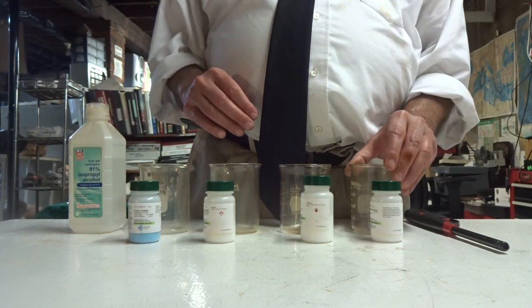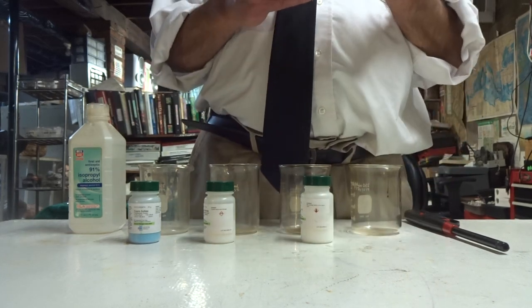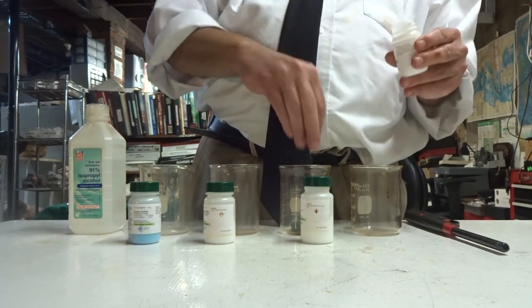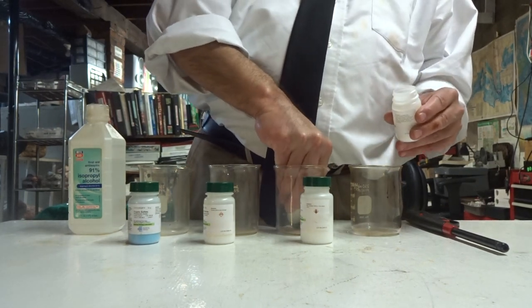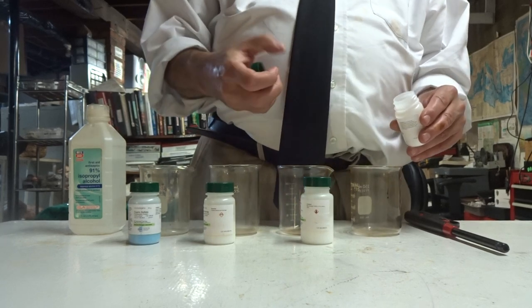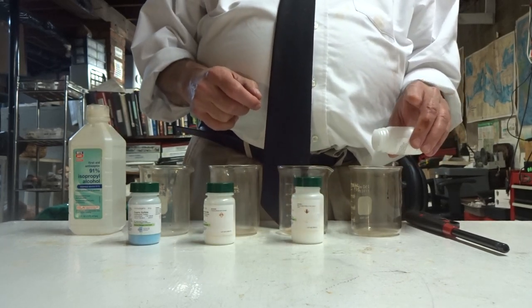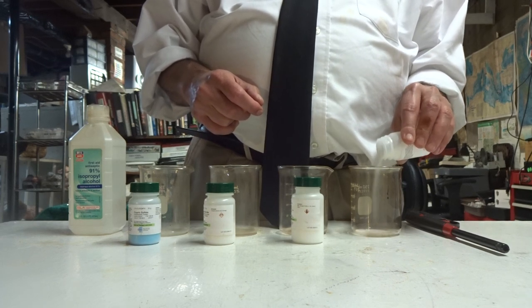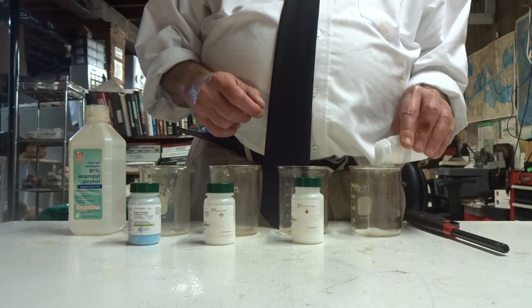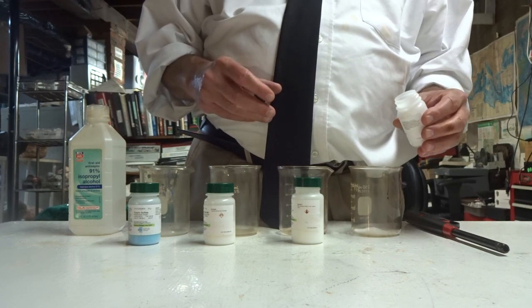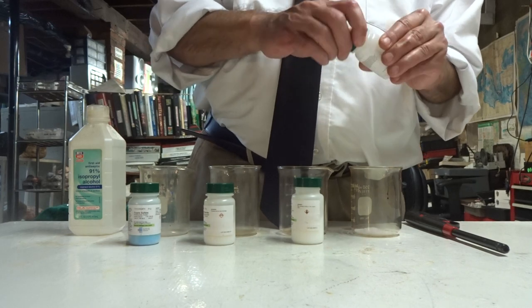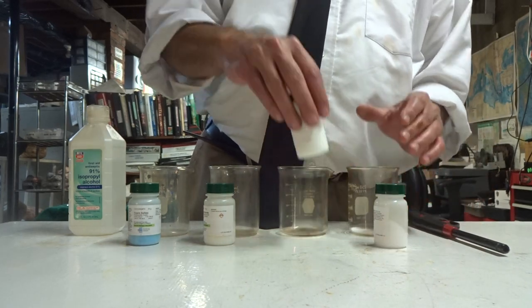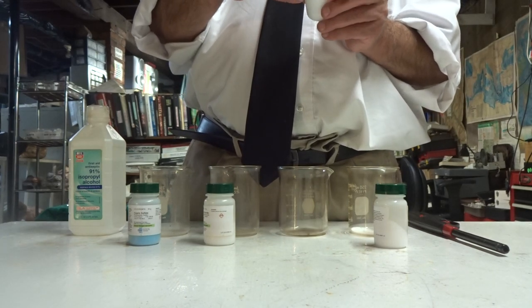I have four beakers. In one beaker, I'm going to add some sodium chloride. The next beaker, I'm going to add some boric acid.